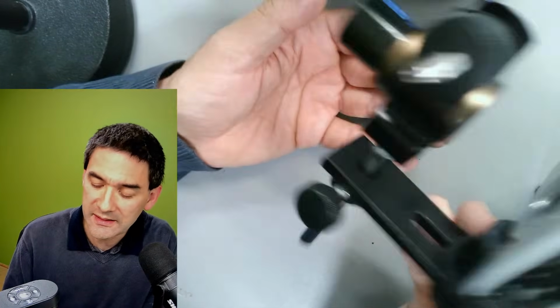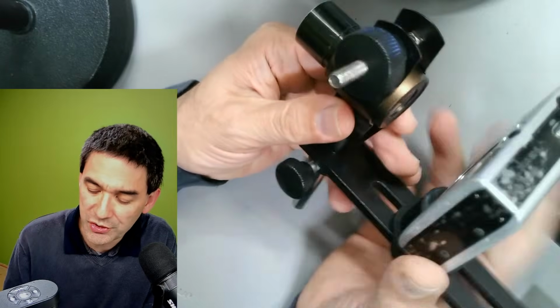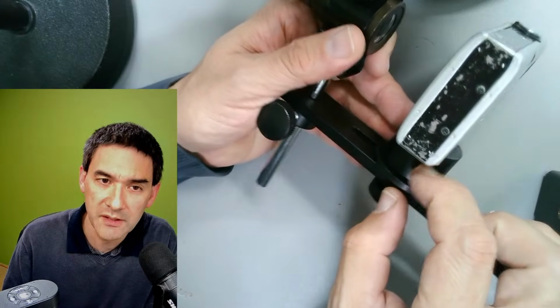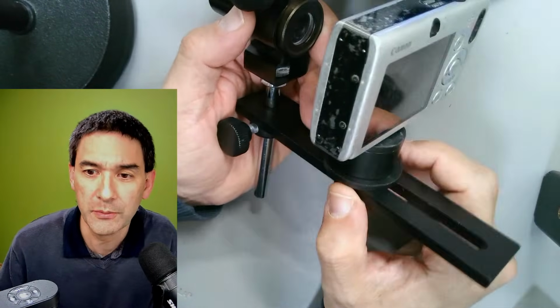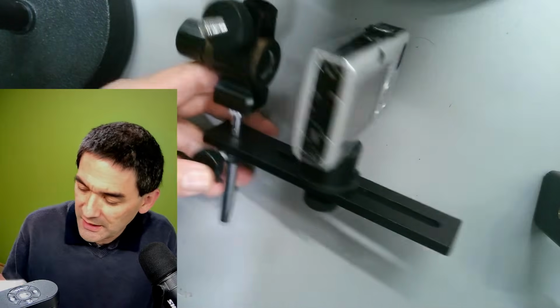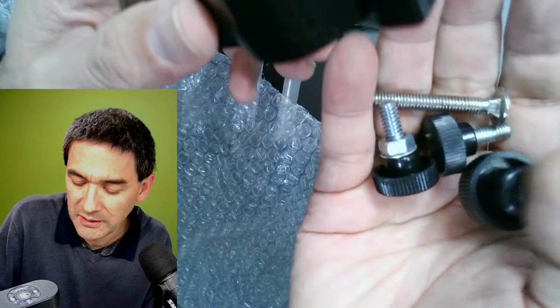It is a little bit bulky, but it's by far, I would say, the most solid adapter. Almost everything is made of metal. Even the spacer here is made of metal. The only things that are plastic are those knobs here, and of course the rubber padding over here, but that's pretty much it. This one is called Digiklemme, and I think they have different versions of it. It came along with a whole bunch of other things as well, for different size eyepieces. You get the idea.